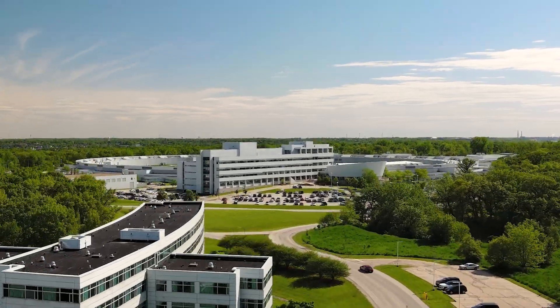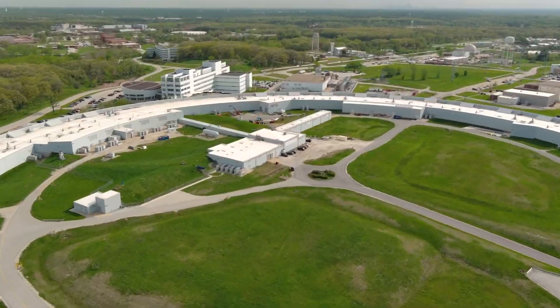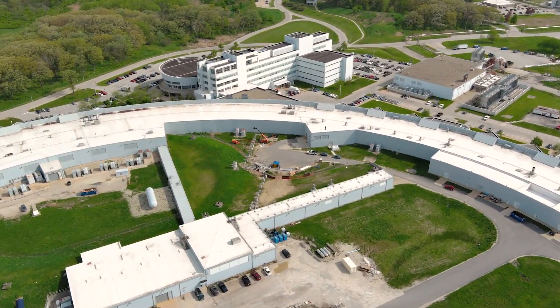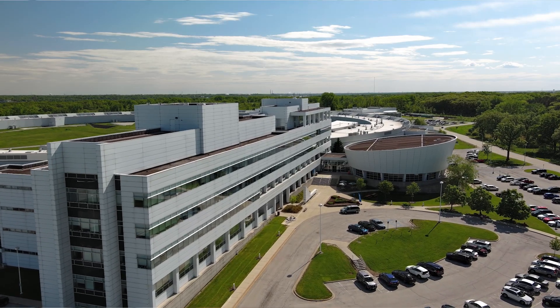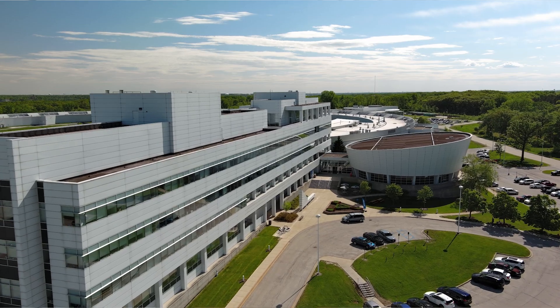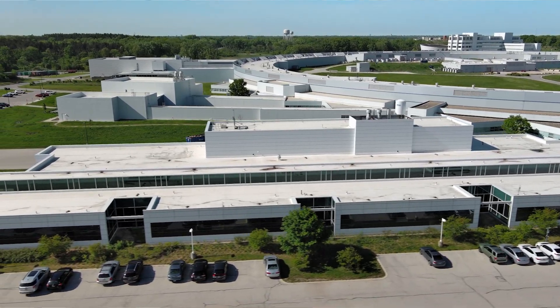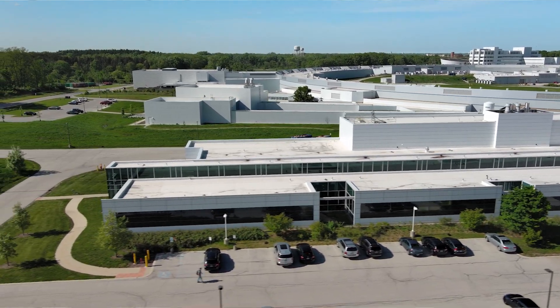The APS is a high-energy X-ray light source that is open to everyone. The APS provides ultra-bright, highly coherent, high-energy X-ray beams for research across nearly all scientific disciplines. These characteristics position the APS as one of the best X-ray light sources for imaging applications.